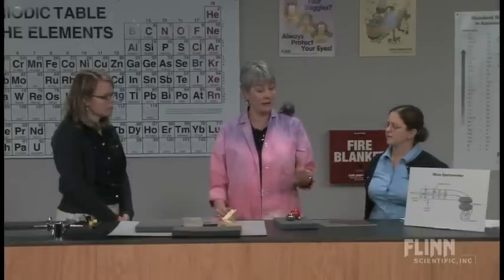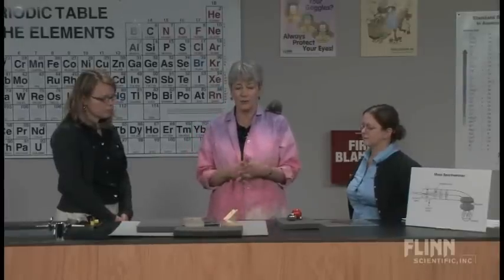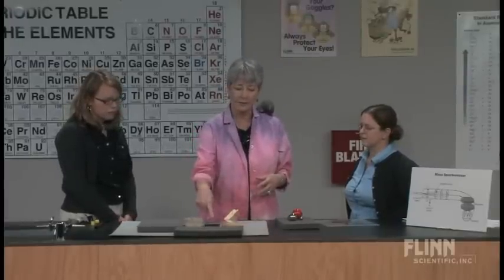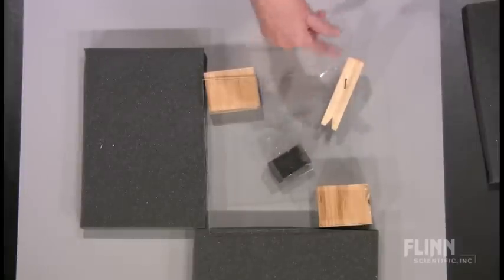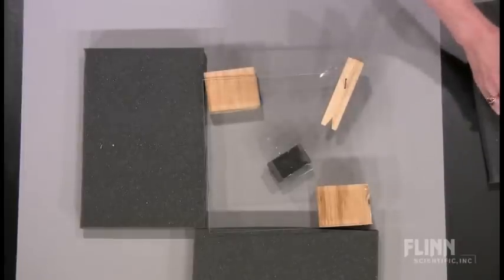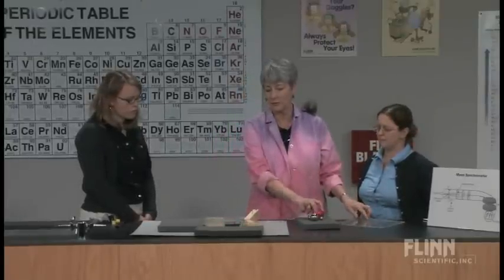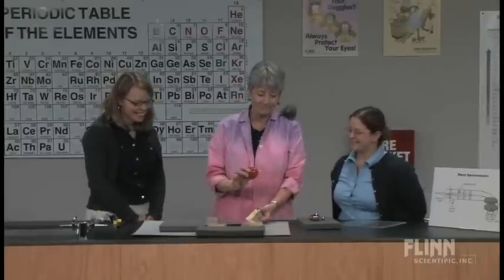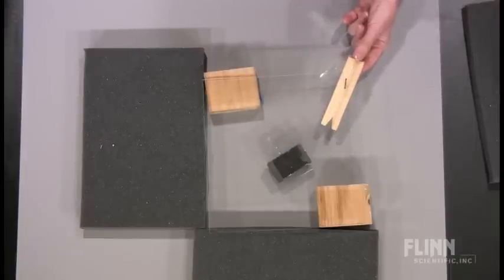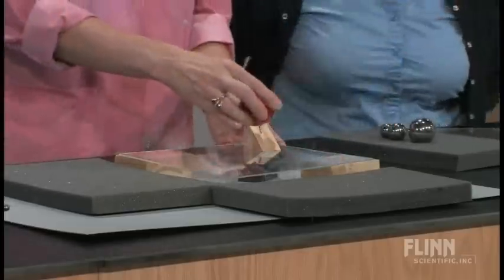I've got this little setup here to demonstrate to the students how a mass spectrometer works. I've got a very powerful magnet pasted to the bottom, and just this little ramp so that I roll all the balls from the same place, and a piece of plexiglass. I've got a pool ball here — if I roll that, where do you think it's going to land? Could you put your finger where you think it will land? Right about there, okay.